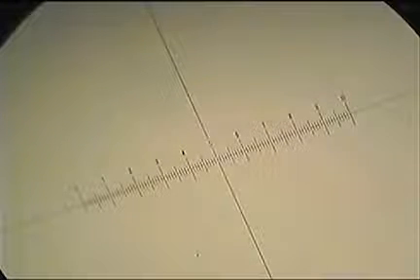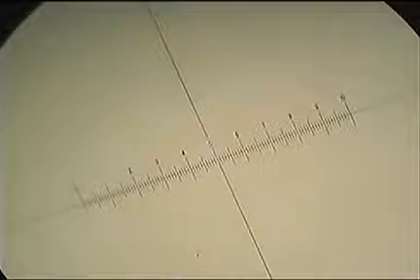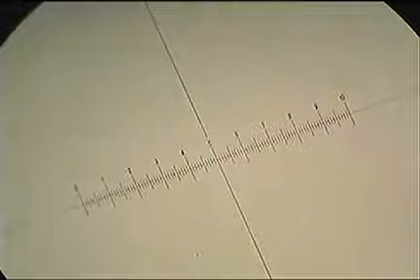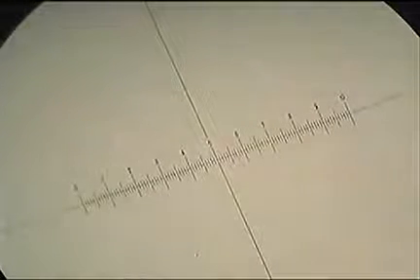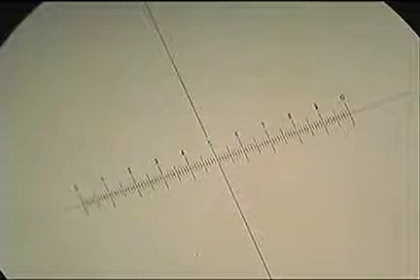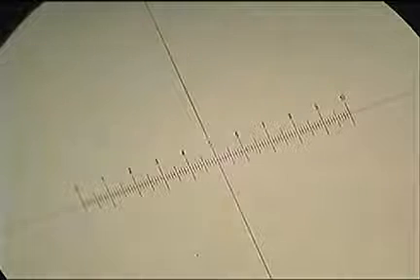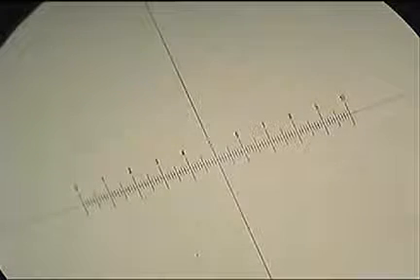Okay, so I'm just going to walk you through how to take measurements of cells or other microscopic structures using an eyepiece graticule and a stage micrometer. So under the microscope, whenever you're looking at things, you'll notice you've got the scale. This is actually something that's in the eyepiece. It's called the eyepiece graticule. Unfortunately, those units don't really mean anything.